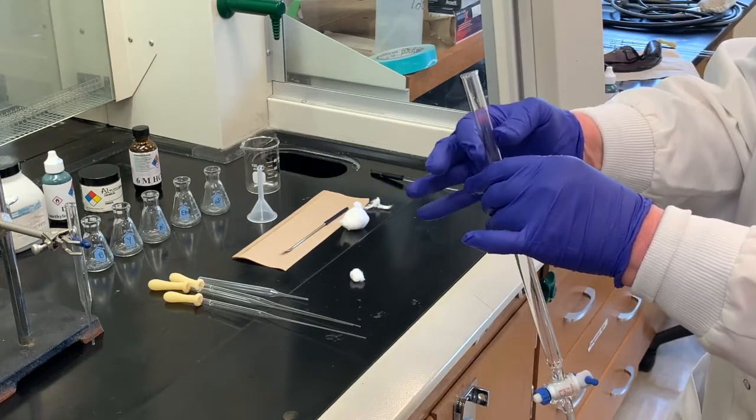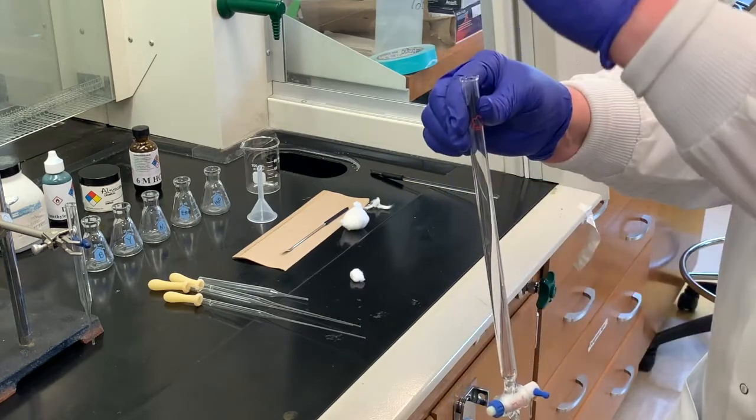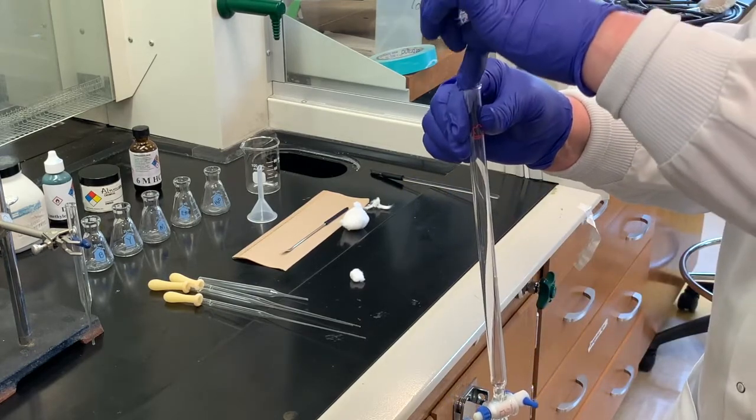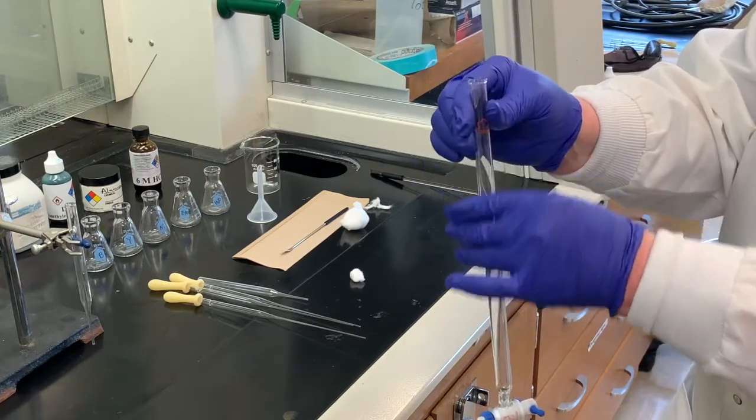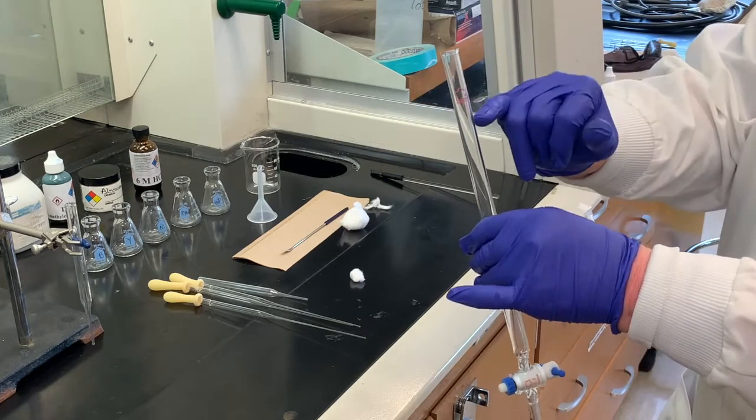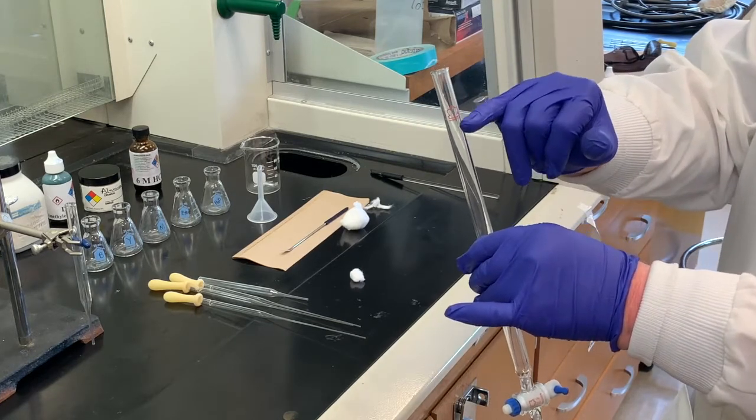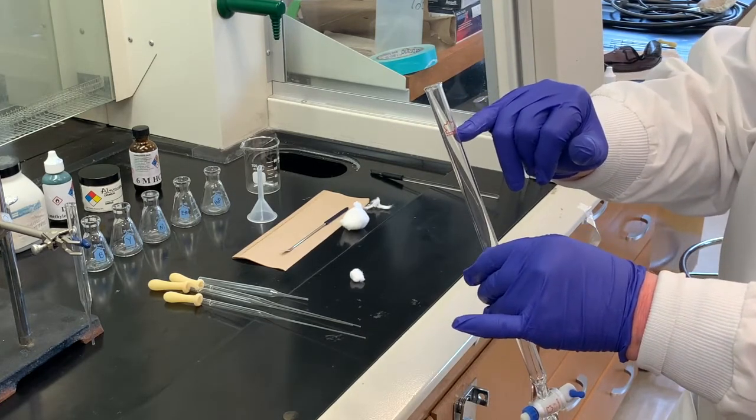The purpose is to add more liquid through the top. And if we add that, we could damage the packing of that adsorbent to start with. So once we add our adsorbent, we're going to top it off with a thin layer of sand.